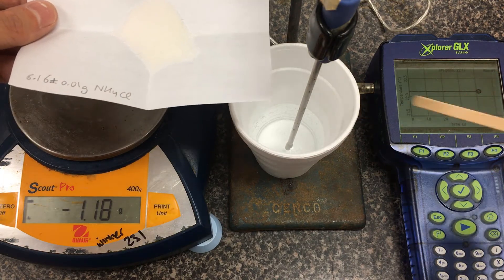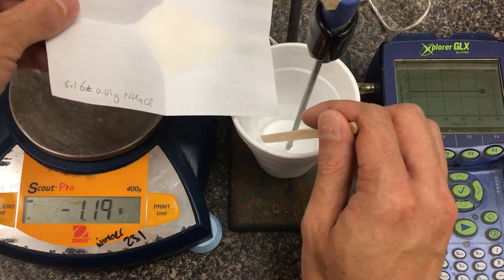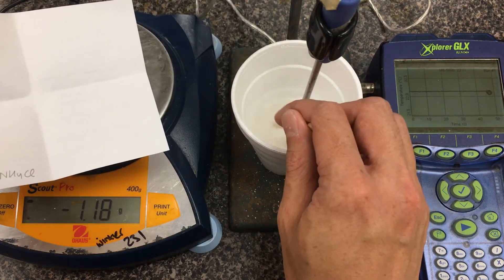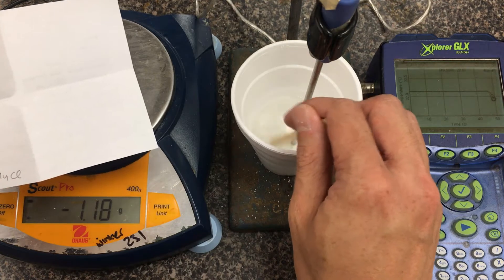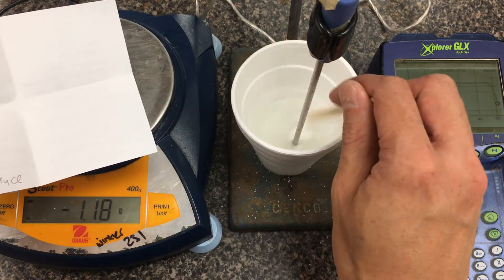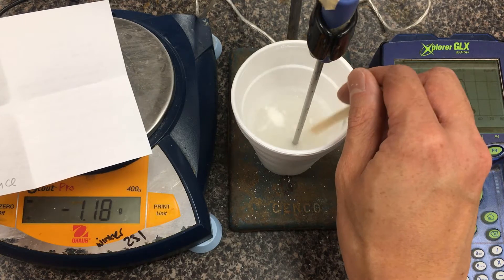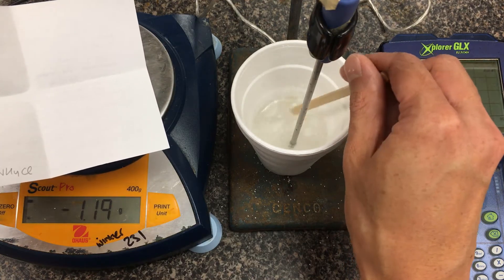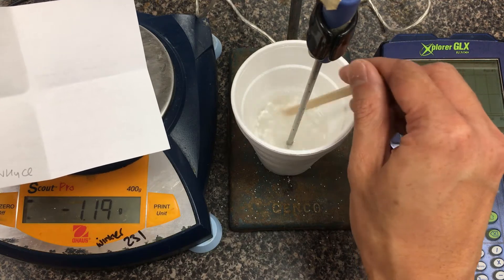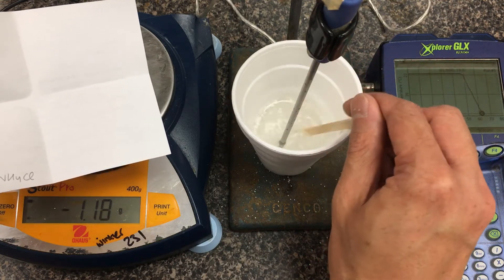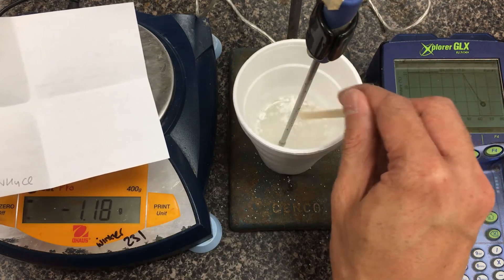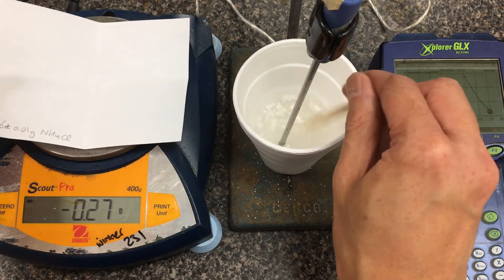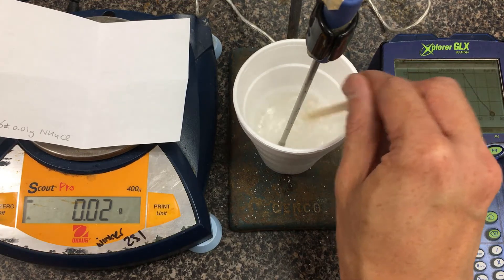We're going to monitor what happens to the temperature as time goes on. I'll pour that in and do a very gentle stir. We just want to dissolve the powder.